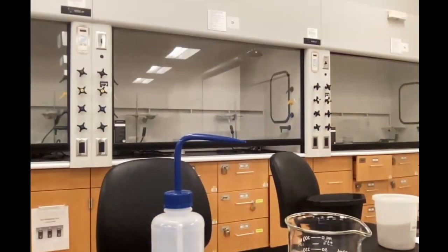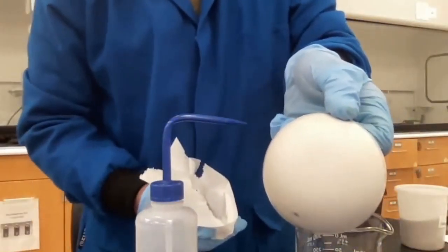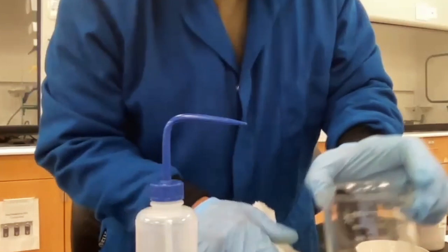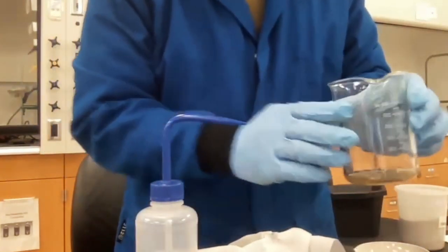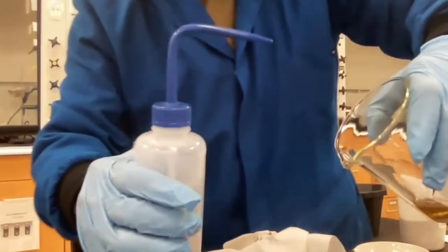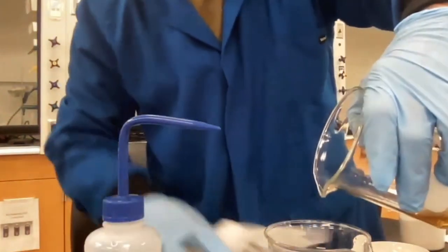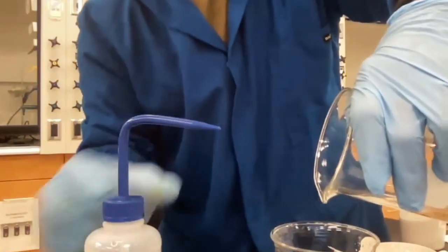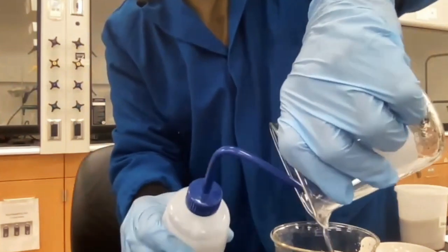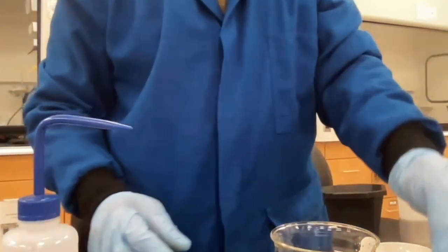Do we just wipe it down? Once that's done, then you can just wipe it down and it's clean. The beaker, after we rinse it, do we just dry it out? Yeah, just make sure that most of the chemical, use your water bottle to kind of spray it. And then as you spray it, in the mouth of your waste container, you can just allow it to drip in like that. Once you get most of it out, then you can just wash it with soap and water. Okay, thanks for asking.